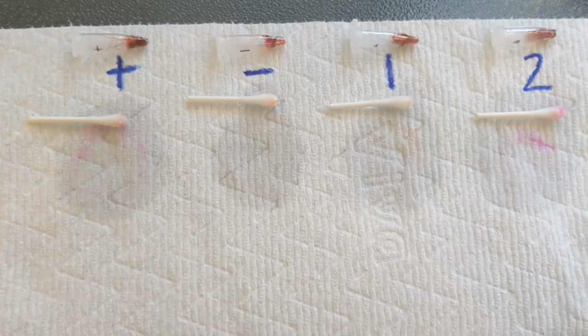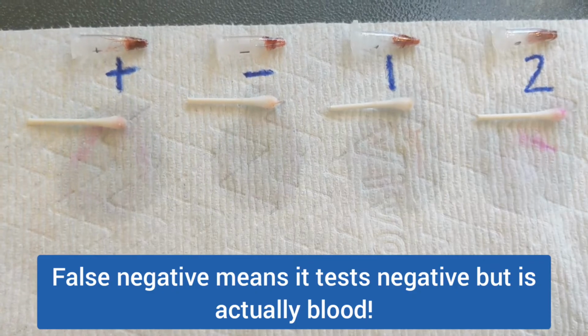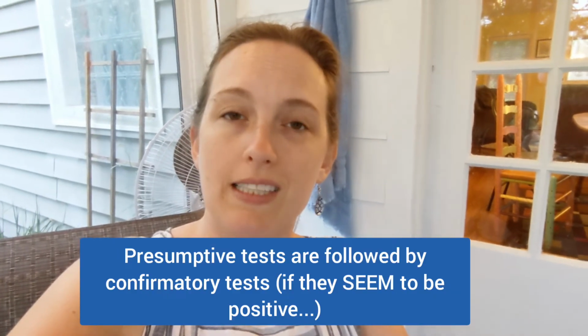They both can have false negatives and false positives. So for instance, it'll glow if bleach is present, and that's a false positive. So this one is a little more precise than the other ones. Also, remember that this lab test is presumptive, so it's not definitive. If it seems as though your samples might be blood, and think about which ones in this case might be blood, then you have to follow this with a confirmatory blood test. So keep an eye out for that video, because that's actually the next test that we're going to run.